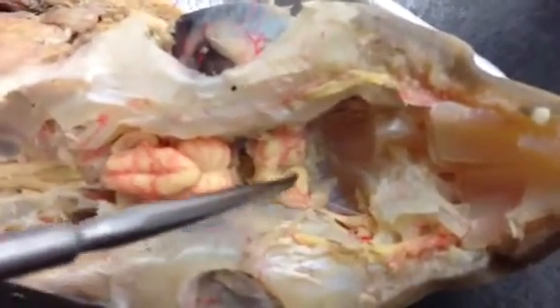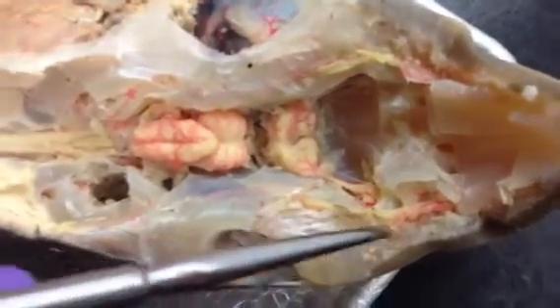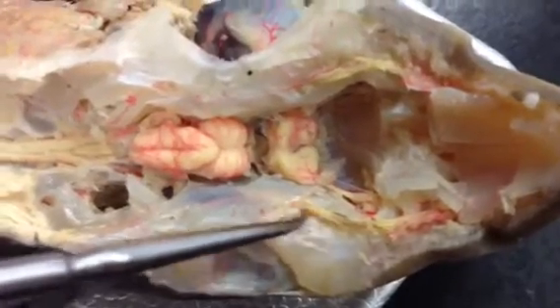You have the bulb, and then the sac sits on the bulb. And then you have the cerebral hemispheres here. All of those structures together are part of the telencephalon. And then to the side, or lateral to it, you have the superficial ophthalmic trunk — you just need to know where it is, which is there on both sides.